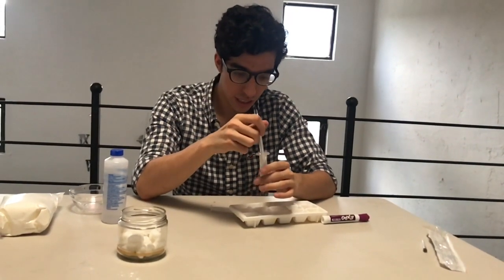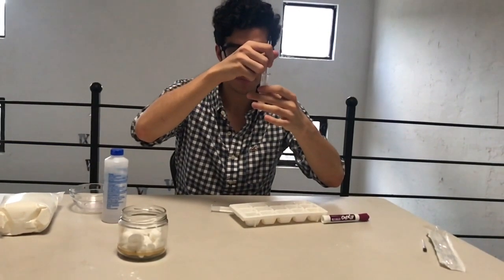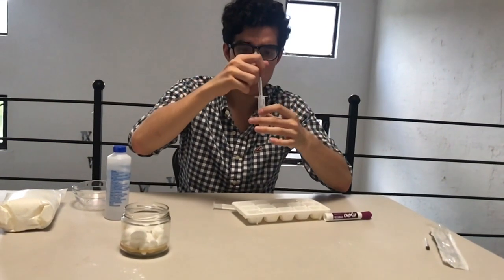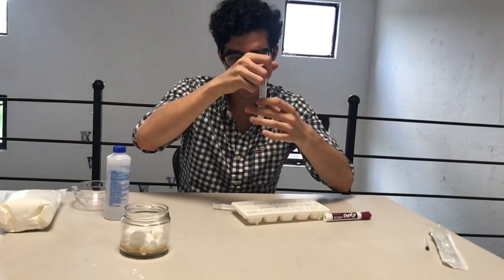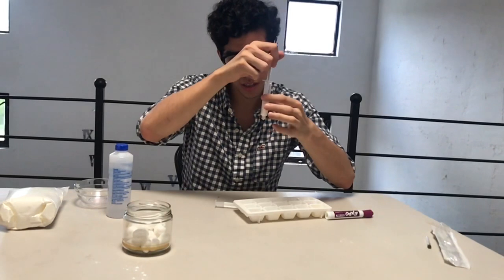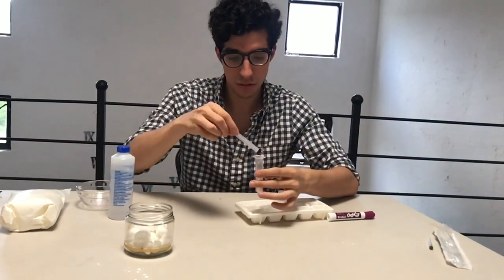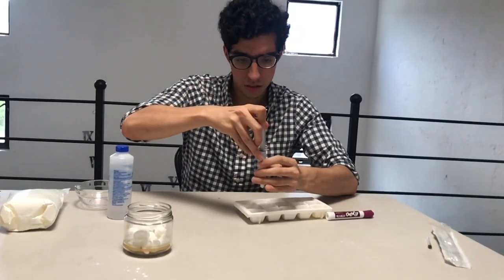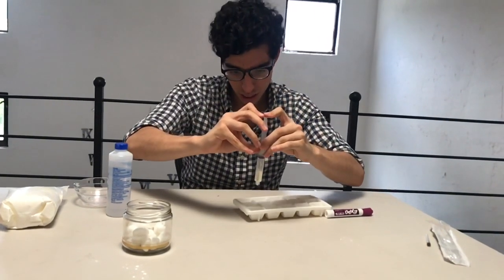We have to be pretty careful and flatten it with too much care, and again try to pull it all the way down like this.